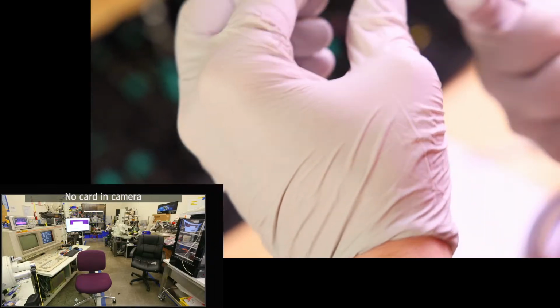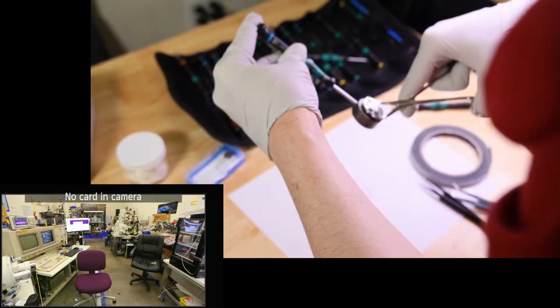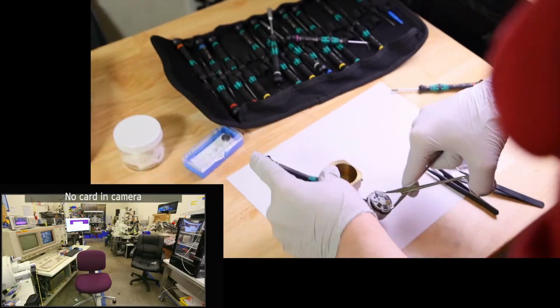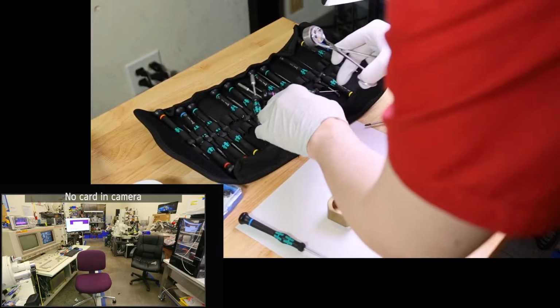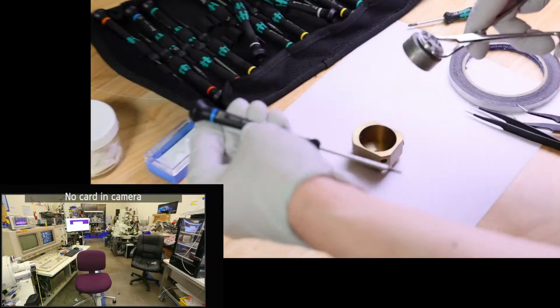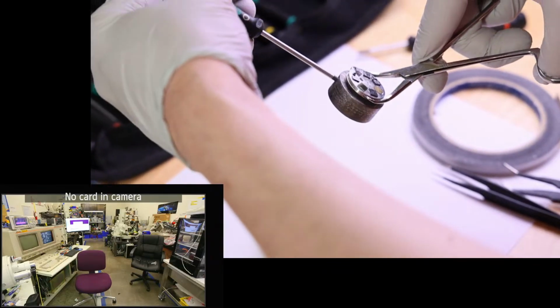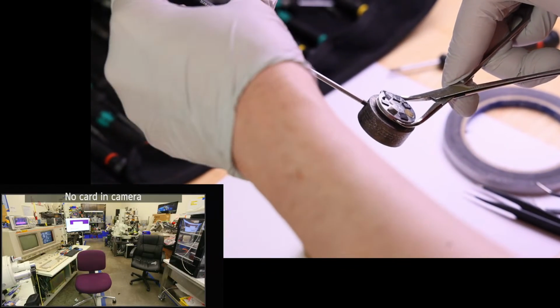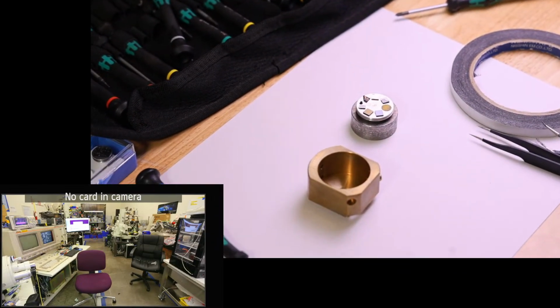There's really no set screw on this one? There is a set screw. Okay, that's what I was expecting. Don't know if that was the right size or not. That's probably one too small, so let's go one size up. I think that's one size up. That's a 2, that's a 1.3, so it should probably be this. That one can't go far enough. Okay, I'm going to grab a set of Allen keys real quick. I'll be right back.